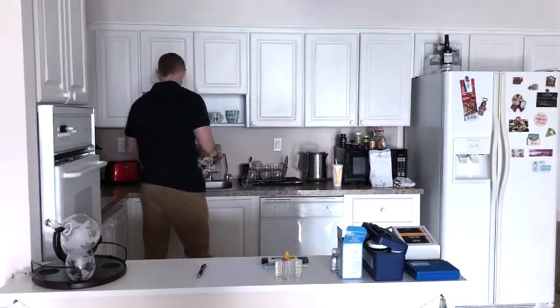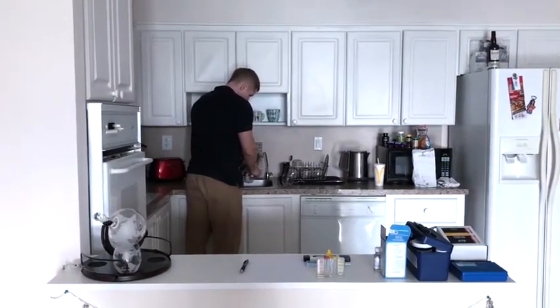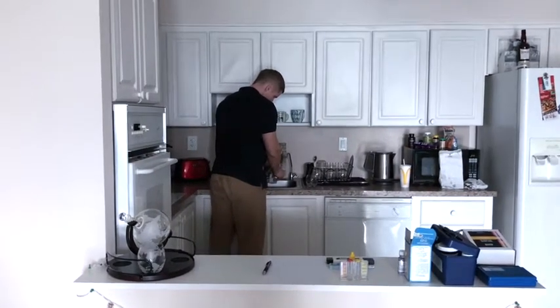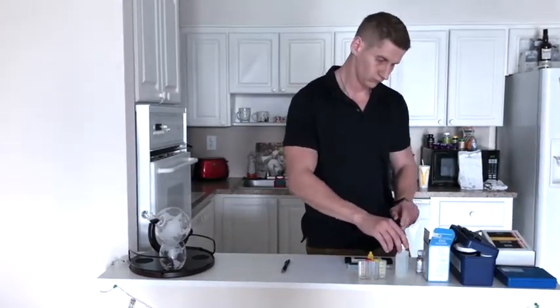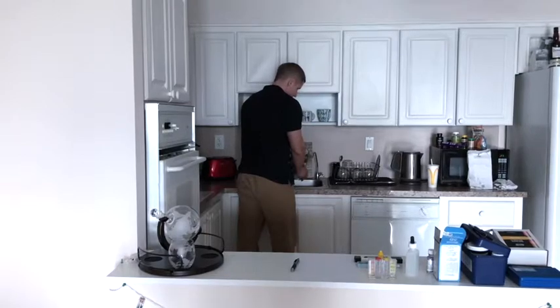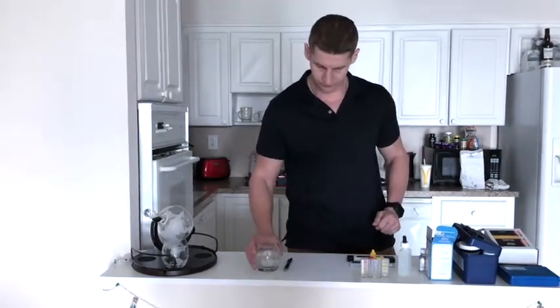The Environmental Working Group, or EWG, recommends that reverse osmosis treated water be used for drinking and cooking. However, before the water system installation, Ionation Company analyzes tap water to reveal the number of the most harmful contaminants. After water analysis, an Ionation specialist can select a system that would fit customers' needs. Today, a specialist from Ionation Company is visiting a family from Sunny Isles Beach to conduct water analysis.